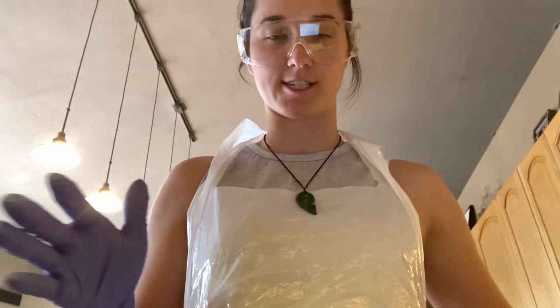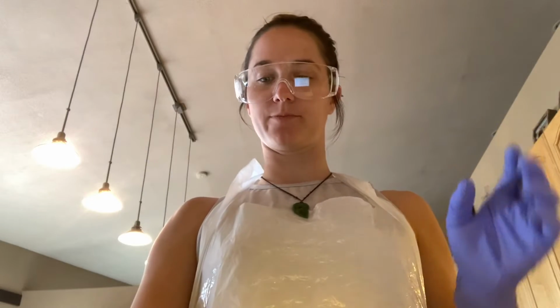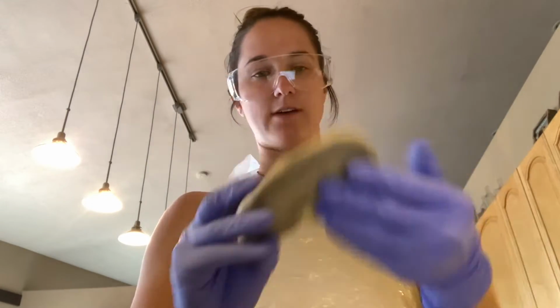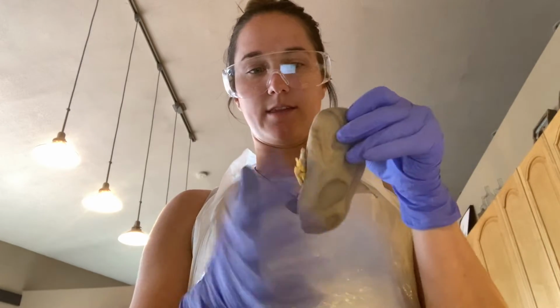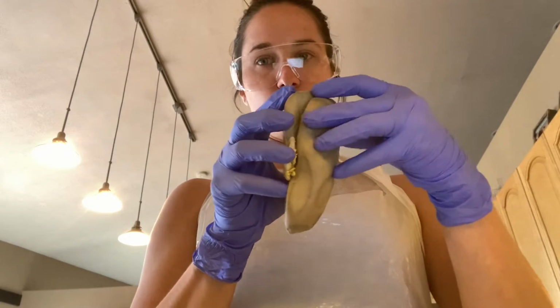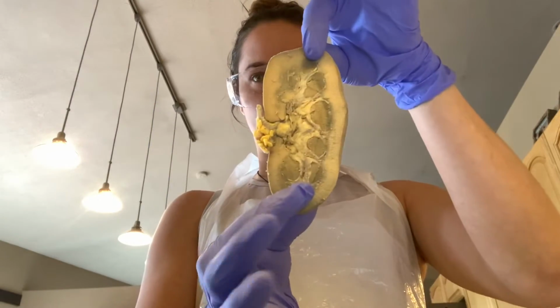Today I finished the last dissection for this course. I dissected a pig kidney. So this is our kidney here. This outside portion is the renal capsule, and it contains everything that we find within the kidney. I also cut it along its coronal plane, so it opens up and we see all the internal structures like so.